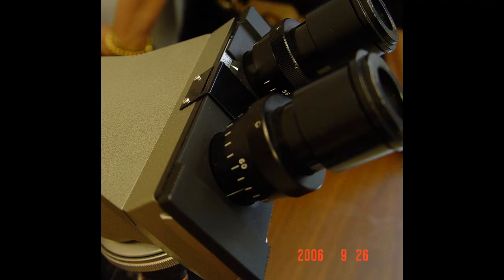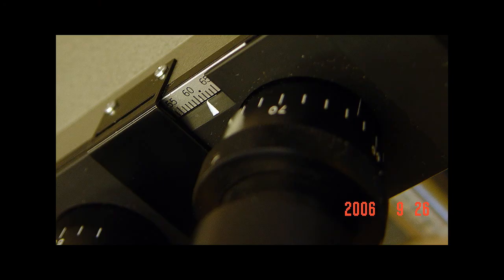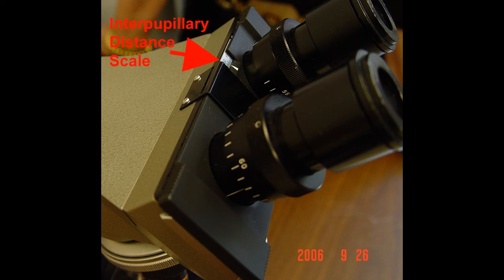Our microscopes are binocular microscopes, which obviously means you can use both eyes to look at slides. What you need to do is move your eyepieces either closer together or further apart so that you're really seeing only one image when you're looking through the microscope. If you're like me and you wear eyeglasses, I usually take my eyeglasses off when I use the microscope, although some people prefer to leave their glasses on. Everyone's pupils may be spaced a little bit differently. These microscopes have a scale near the oculars that measure interpupillary distance. You can note your interpupillary distance so that if you move from one microscope to another, you can immediately set the ocular to that interpupillary distance and you'll be ready to look with both of your eyes.